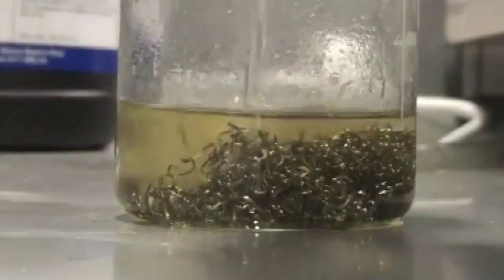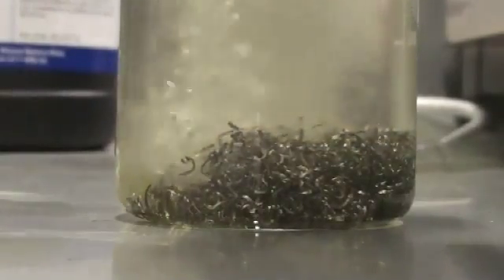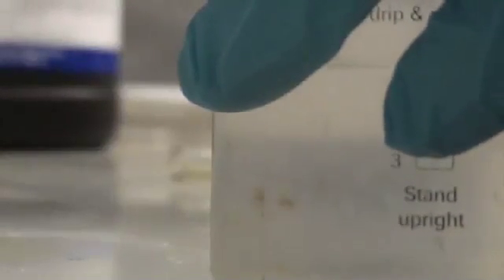If you get really reactive, very small uranium turnings, sometimes you get clouds of NO2 coming off. The trick with this is to leave it just long enough that you get rid of all the black oxide layer, but not too long that you start eating away at the actual nice shiny metal and end up with nothing left. So you just have to keep an eye on it. All the time you can see the solution getting darker and darker because of this NO2 component coming off.